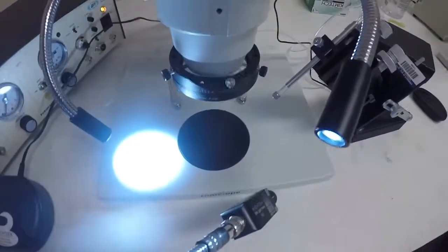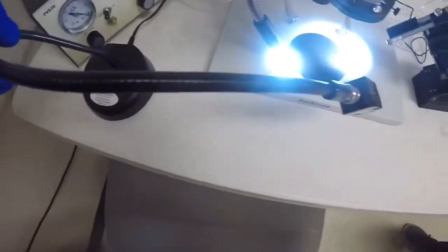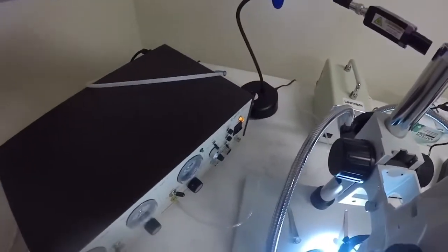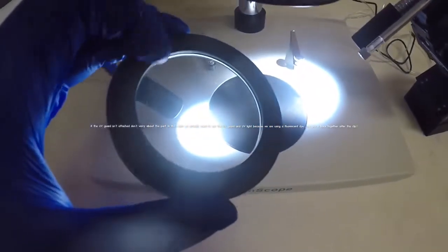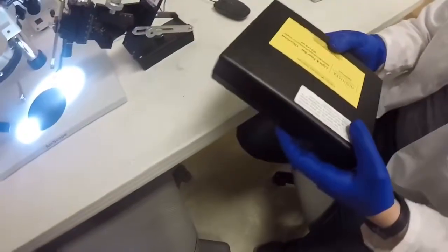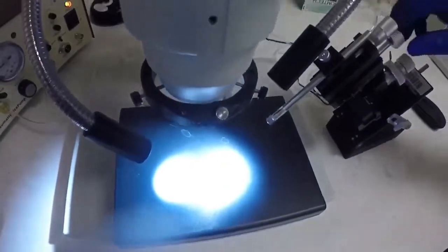You'll see your lights come on right here. Make sure they're oriented appropriately. This other light is used to see fluorescent dyes, so you don't really need to worry about this. It's a UV light, so it's actually probably best that you don't mess with it too much unless you're going to be looking at something that has been fluorescently tagged. You'll want to take this UV guard off very carefully since you're not using the UV light. It causes things to be a little blurry if you don't take it off, and you can put it right back in here in this black case. We generally leave this black case sitting right here because it helps with the injections, bringing your surface a little closer to the lens.